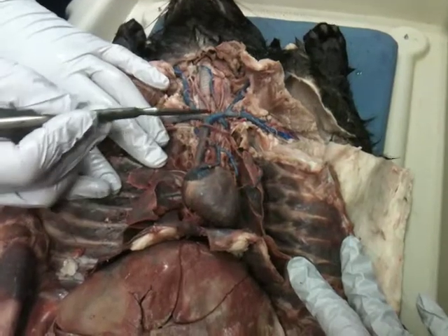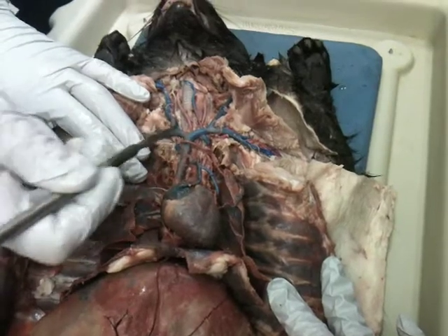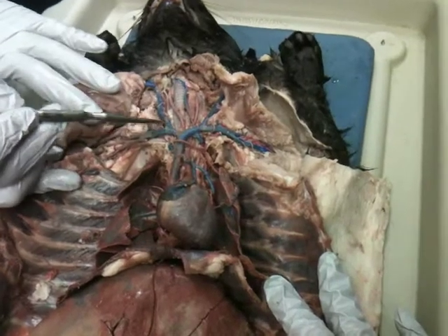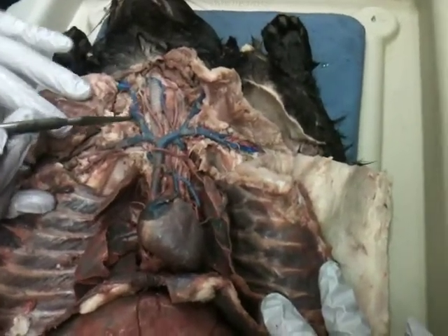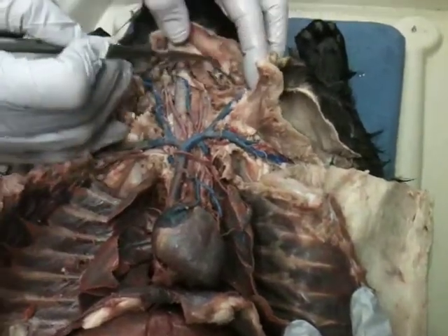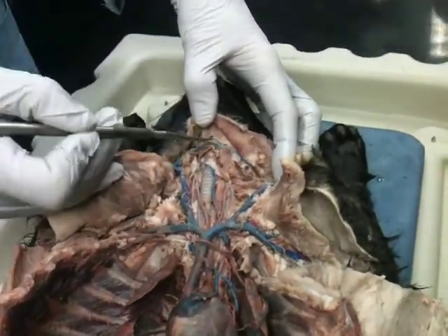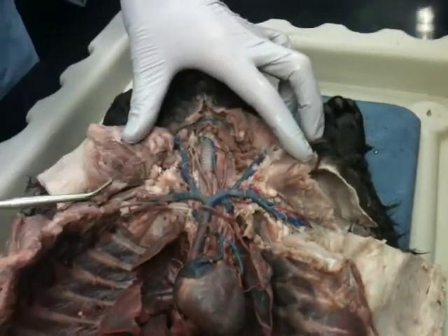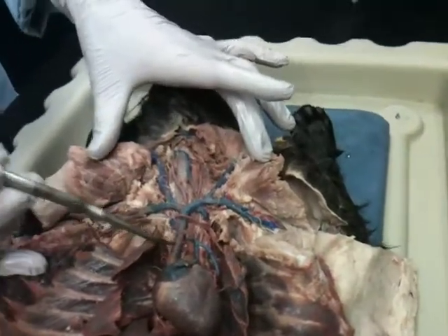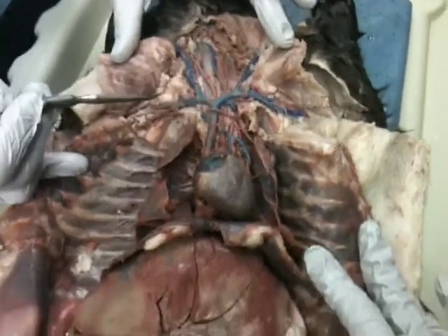The superior vena cava divides into brachiocephalics. Pretty much any time a vessel divides, it changes names. So we're going to divide again here. Going to go to the external jugular vein on either side. They will have a part up here, the transverse jugular vein, going on the transverse plane across like that. Transverse jugular, external jugular. Generally, the internal jugular does not get stained very well, as these are latex, a rubbery product that goes in, so we do not hold you responsible for the internal jugular vein.